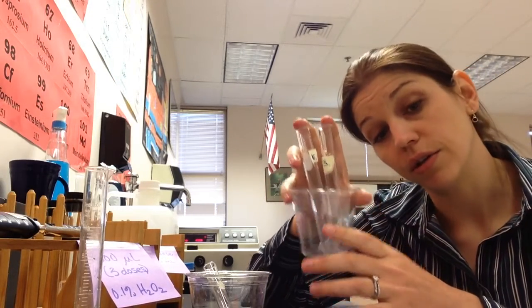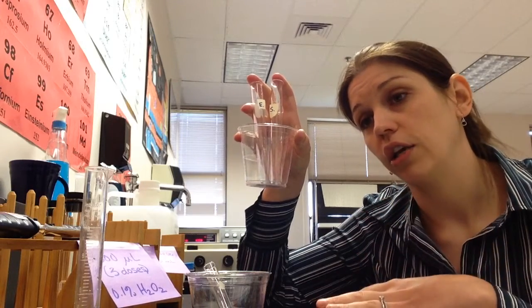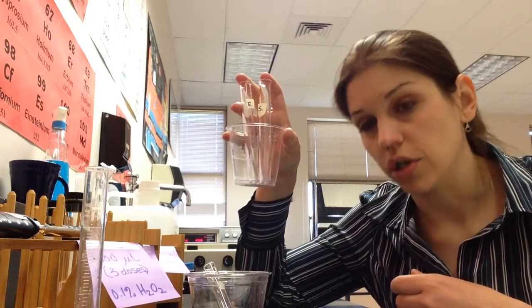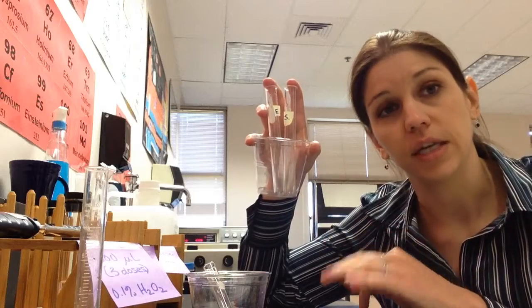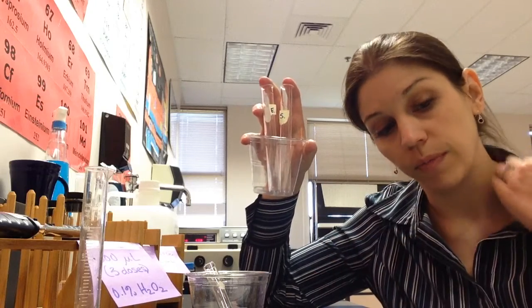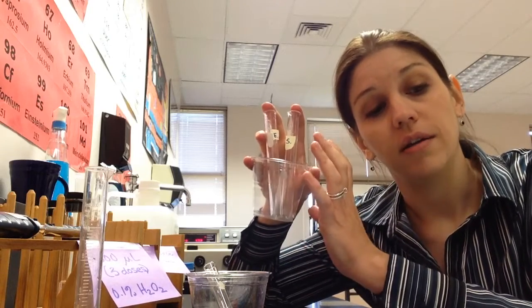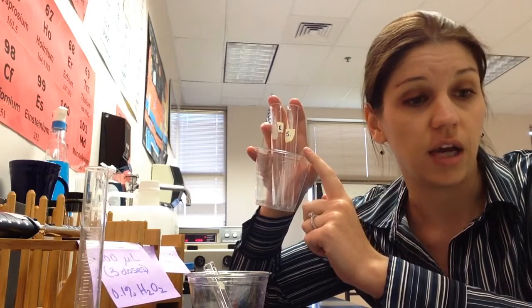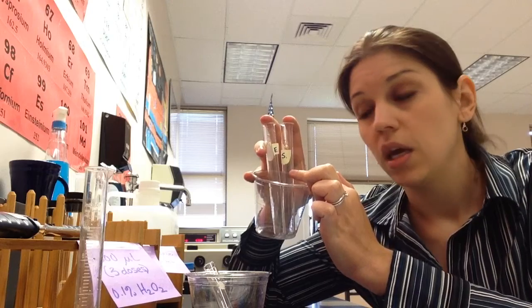by labeling our test tubes, because if you put something in the wrong test tube, you're going to end up starting your reaction without getting a color change, and it being finished before you even get to a spectrophotometer, or getting no color change at all, or something silly like that. So you want to make sure that you keep straight what is your enzyme test tube and what is your substrate test tube. Both of them are mostly water, and so it's easy to start by saying, okay, I need to put 6 mils of DI water in your enzyme test tube and 7 in your substrate test tube.